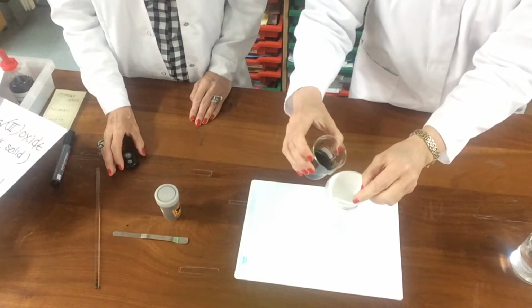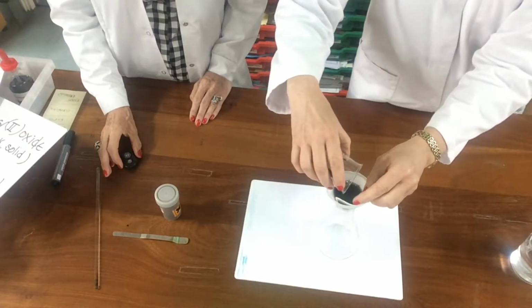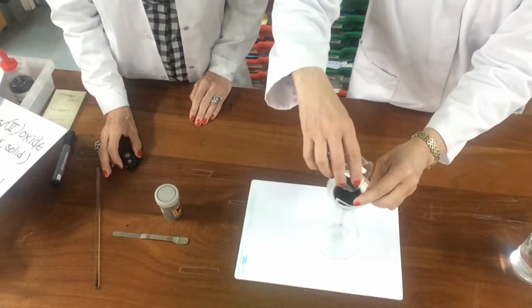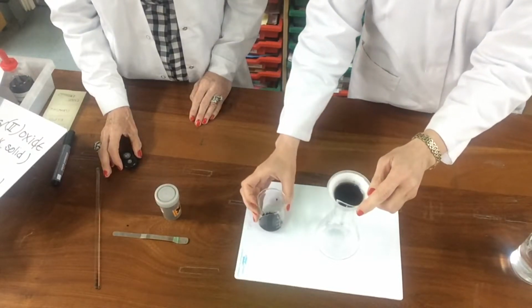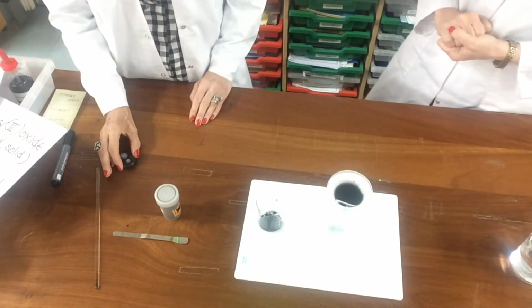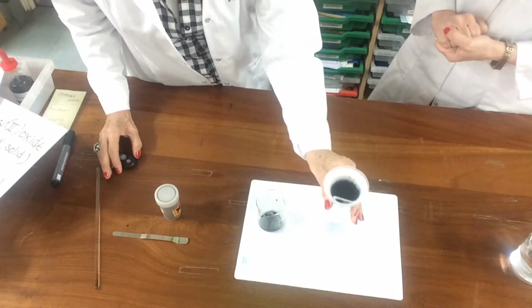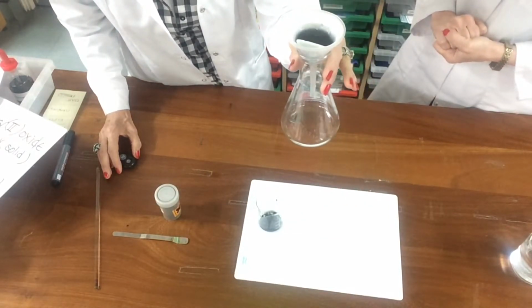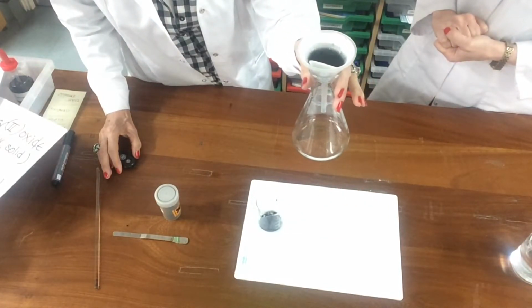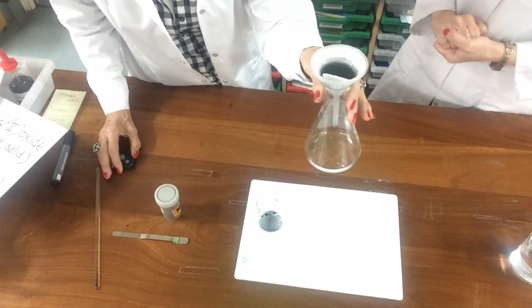We just pour our mixture, give it a bit of a stir so we get all the solid into the filter paper, don't need all the solid there, and let it drip through, and then we'll be able to see the colour of the copper 2 sulphate which has been formed. And you can see the copper 2 sulphate is dripping through, and your copper 2 oxide is remaining in the filter paper because that is excess.